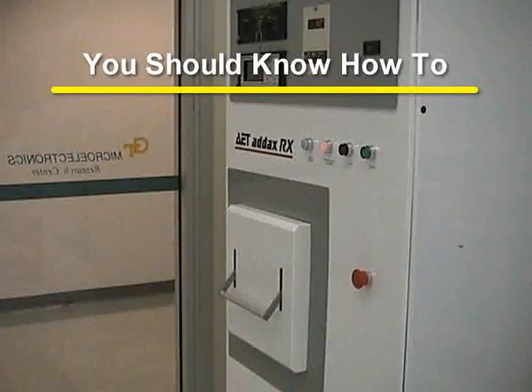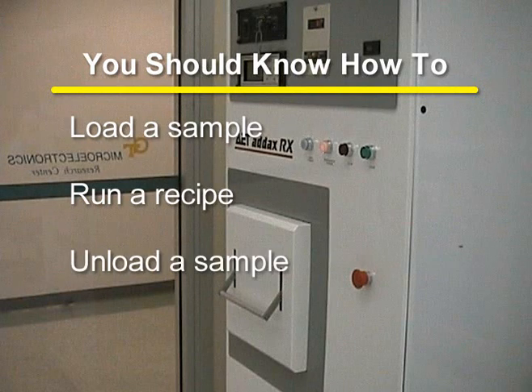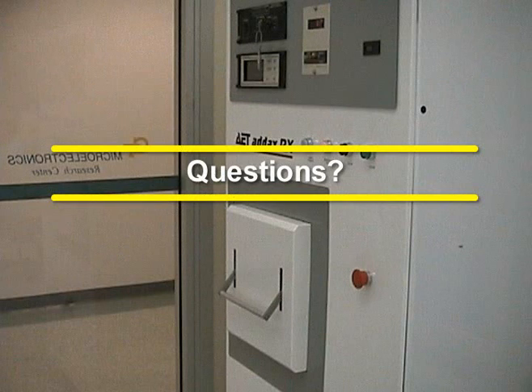After watching this training video, you should know how to load a sample, run a recipe, and unload a sample. If you have any further questions, please direct them to the trainer for this equipment. Please do not direct your questions to Mohammed.